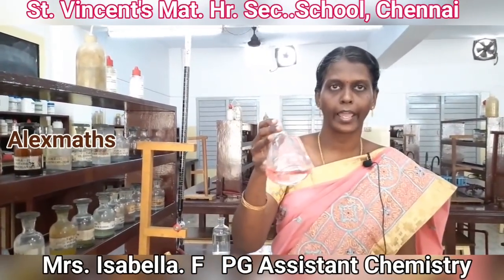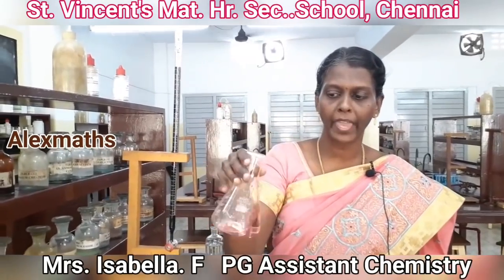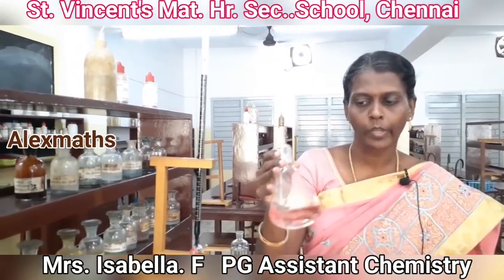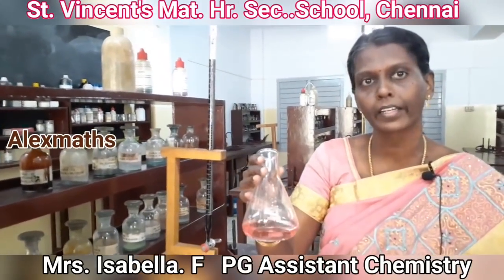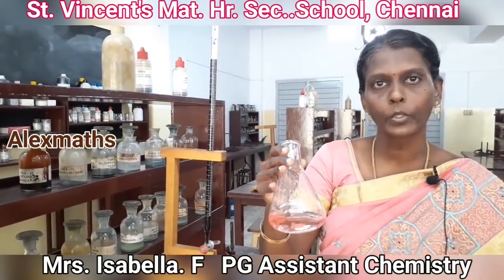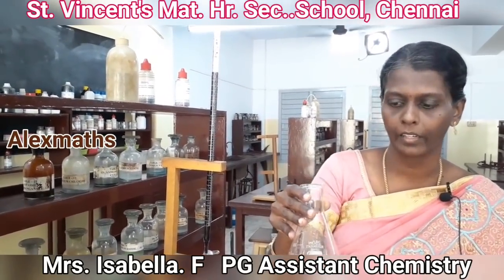So this is your end point. At the end point we will get a permanent pale pink color. So care should be taken that we do not add too much of potassium permanganate, otherwise the color will be too dark. So this is the end point, the permanent pale pink color.